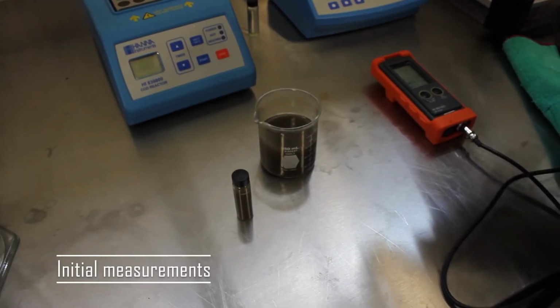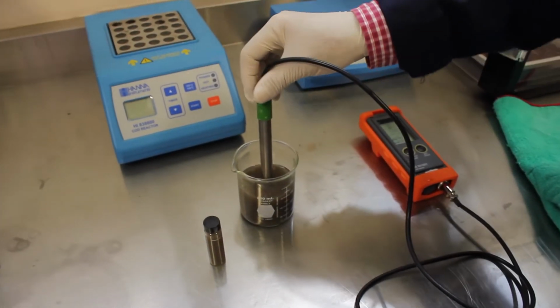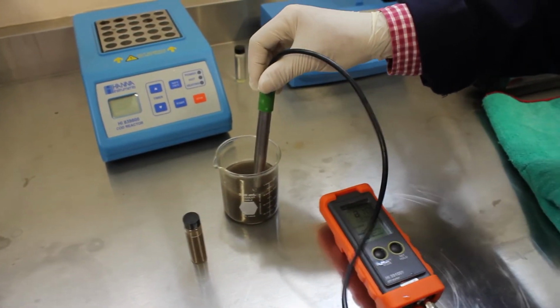Initial measurements, start with pH. We're going to use a pH meter, so you're going to hold it in until we get a steady measure.